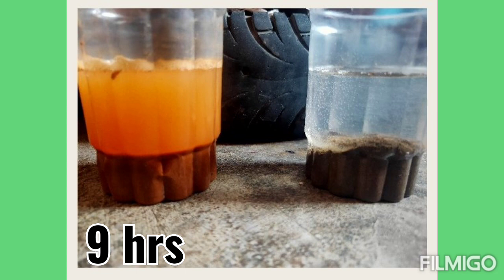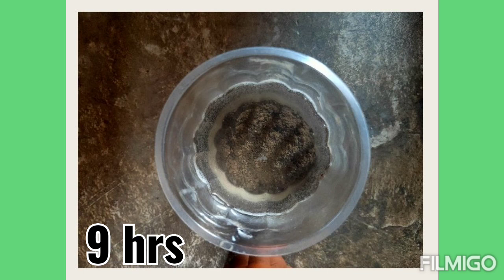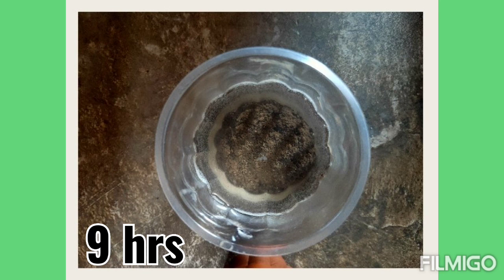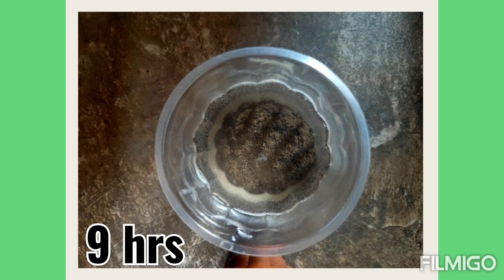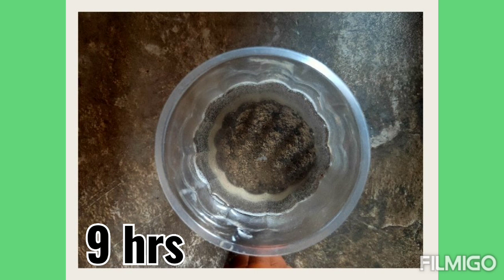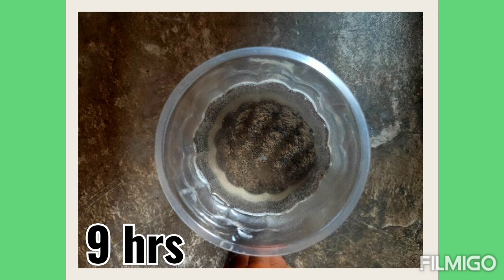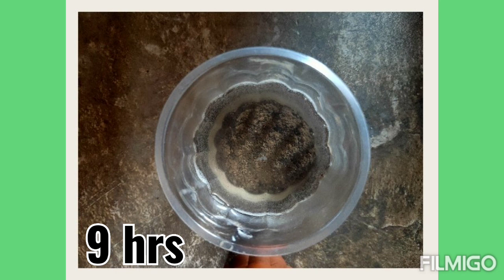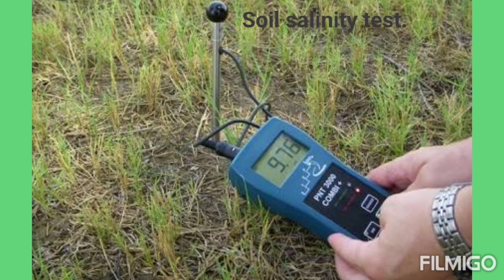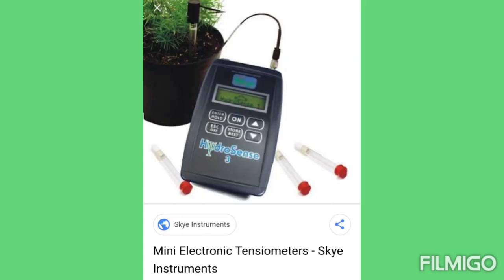From the two balls, I have seen that one ball is completely soluble quickly and the other ball is taking a lot of time and is not easily soluble. So that soil — the one that takes more time to dissolve — is best for cropping. This is a traditional way to check soil quality. In the labs, you will learn other modern techniques.